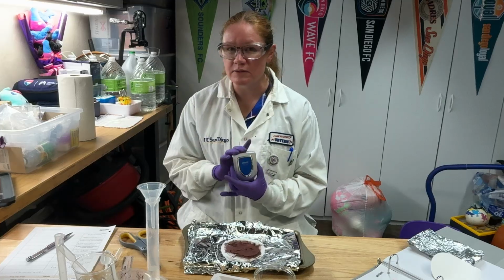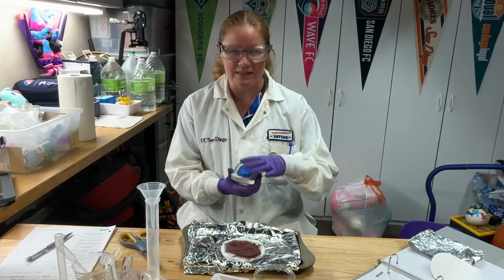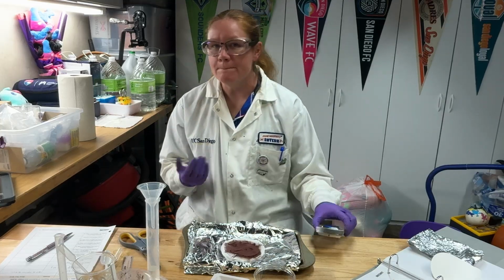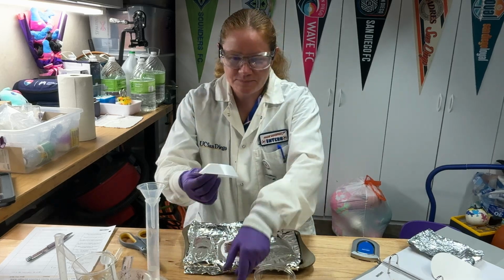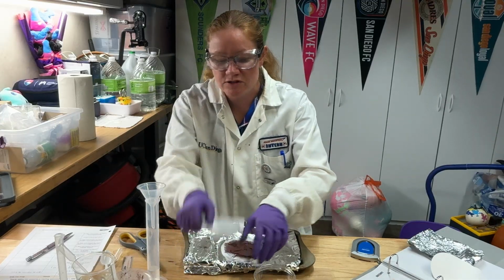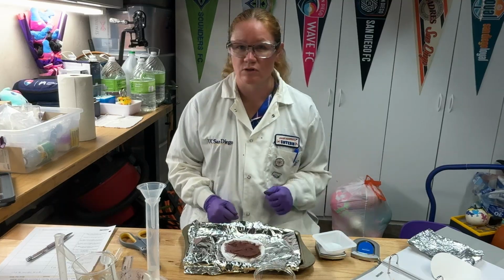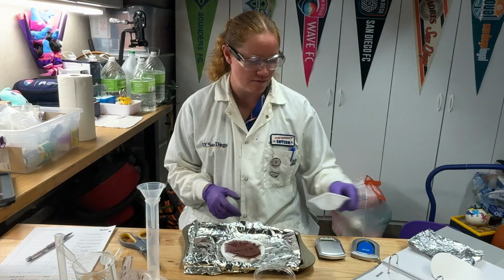But these balances are really small. And once you get that product off, trying to keep it on the filter paper, because the filter paper is fairly big compared to the balance, might be a little bit difficult to not lose it. The weigh boat, the circle of this does not exceed the size of the balance. And so you'll be able to get a more accurate mass by having that circle on there instead of the big filter paper falling off the edges.